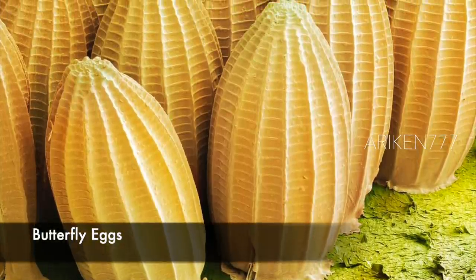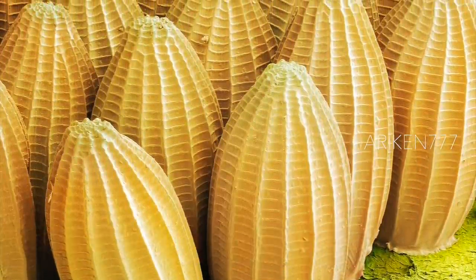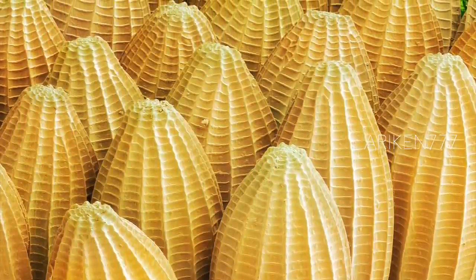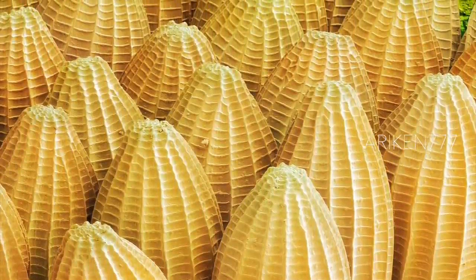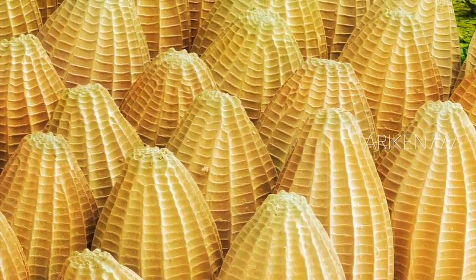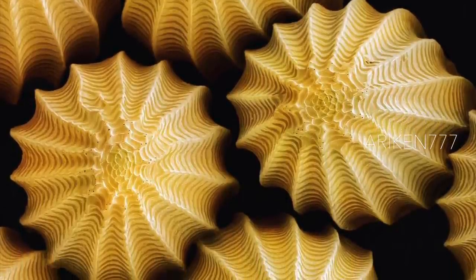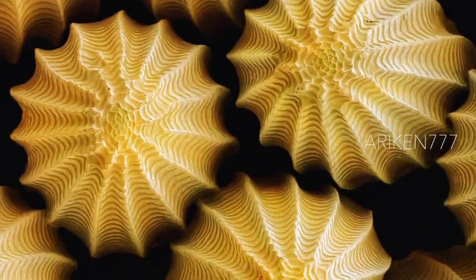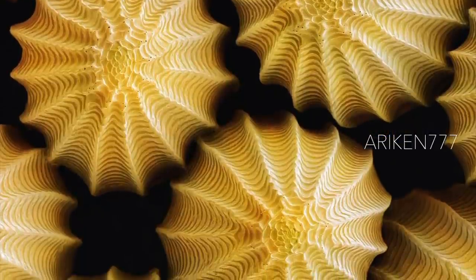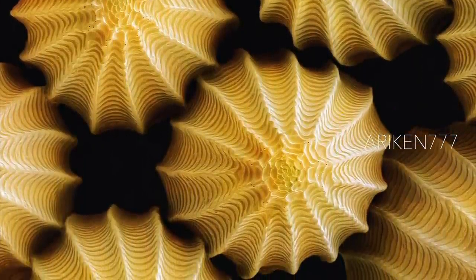Eggs of the cabbage white butterfly. The sculpted egg shells are made of a protein called chorionin and have aeropyles or breathing pores that allow air to flow to the developing embryo. These eggs are laid in batches of up to 100 to 150 on the underside of brassica plant leaves, hatching after about 10 days. Once hatched, the caterpillars feed on the leaves.